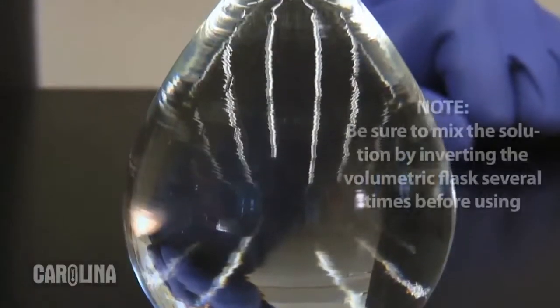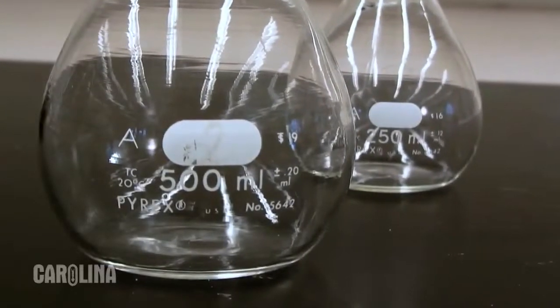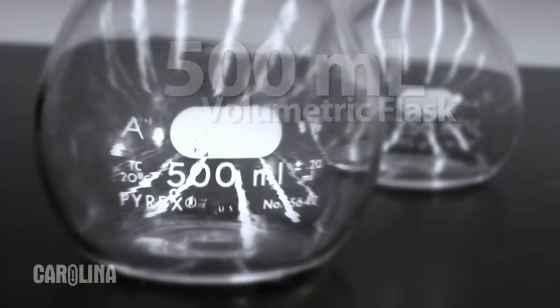At this point, there is exactly 500 milliliters of solution with an error of 0.2 milliliters. Different volume flasks have different error values. However, the error on a volumetric flask is much lower than any other type of glassware of similar volume.